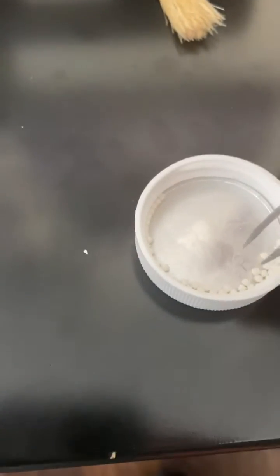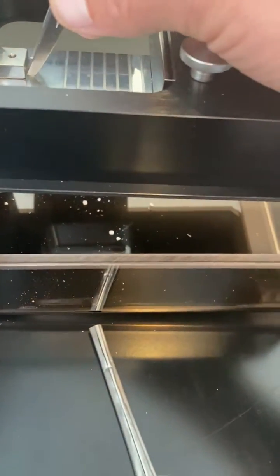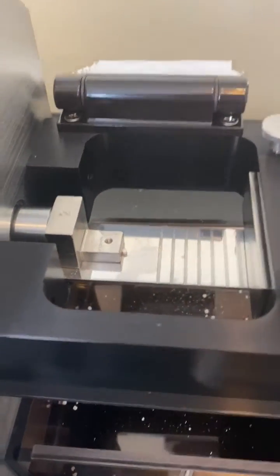I'm having to use my tweezers here. It's important to align the tablet properly. We don't want to test it lengthwise because then we'd be measuring the thickness and the wrong hardness. I'm going to start again.